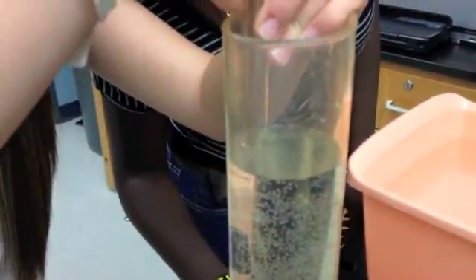Push it so that the two liquids are the same. That's it, right there. And tell me what the number is. 48.5. Here we go.